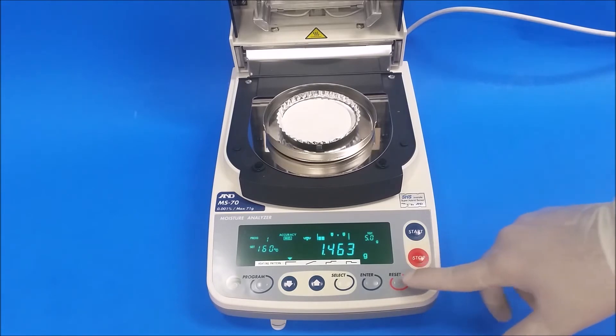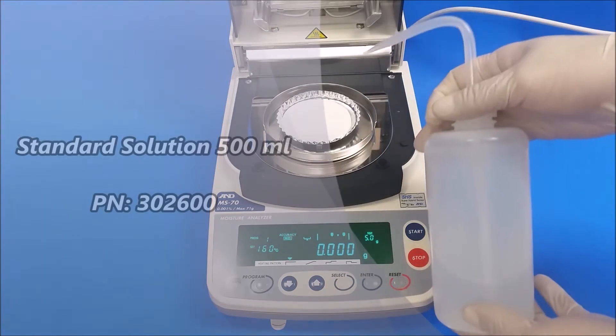Now we're gonna press the reset button. This will tare it.